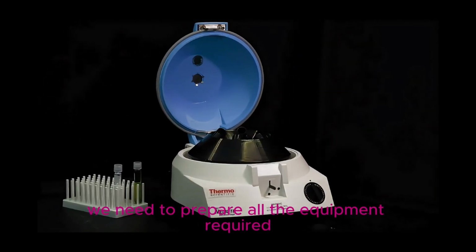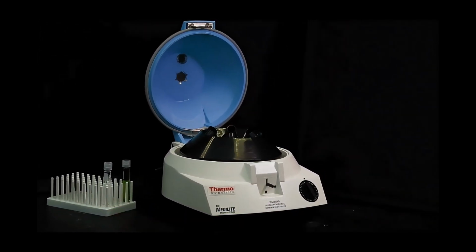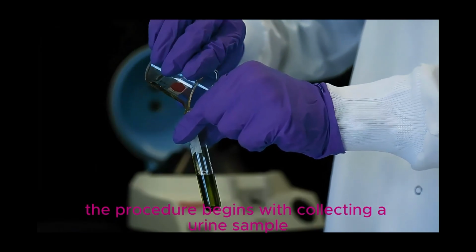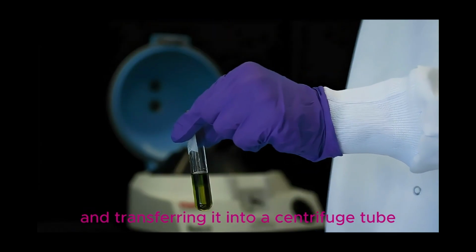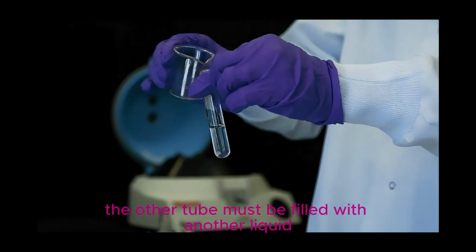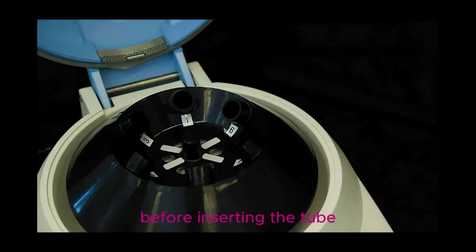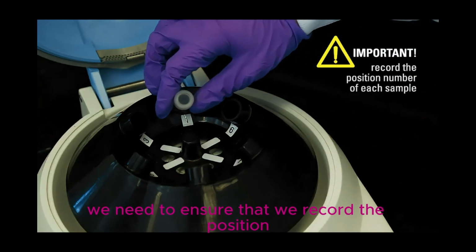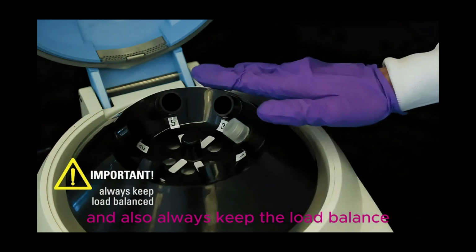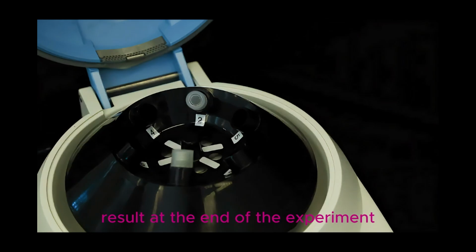First of all, we need to prepare all the equipment required for this experiment. As shown, the procedure begins with collecting a urine sample and transferring it into a centrifuge tube. To ensure balance, the other tube must be filled with another liquid with the same volume as the first tube. Before inserting the tube, we need to ensure that we record the position number of each sample for sample identification, and also always keep the load balanced so that we can get accurate result at the end of the experiment.